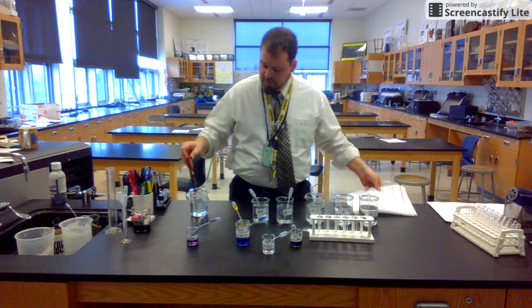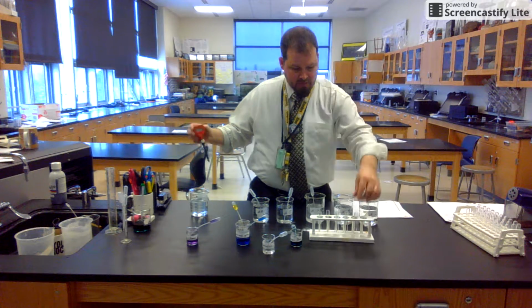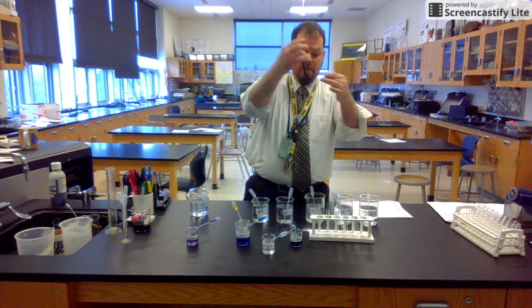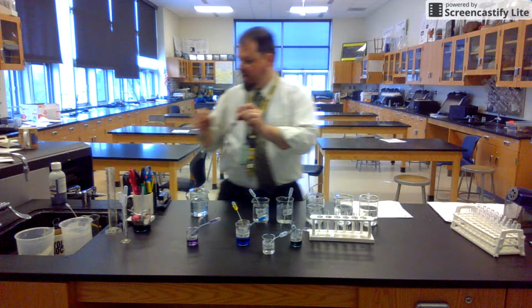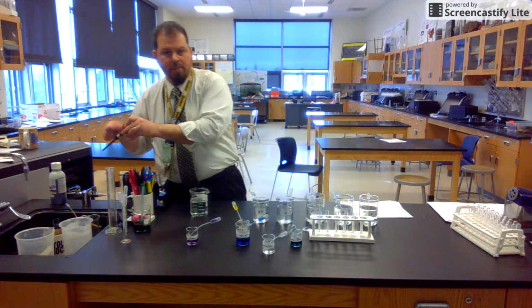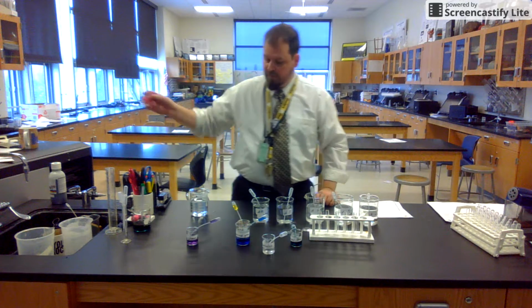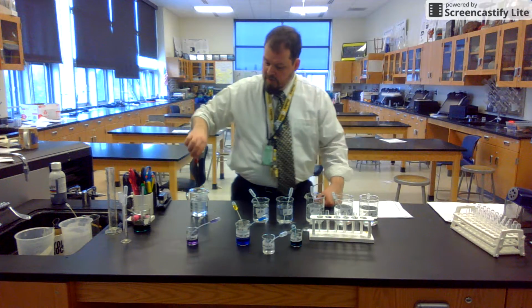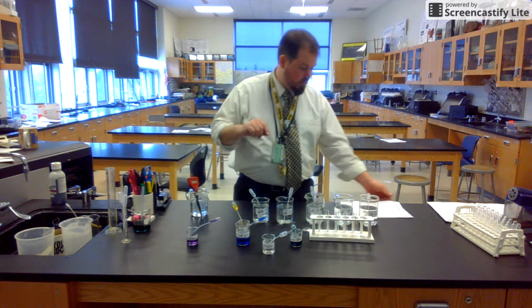You need to use the good old-fashioned pH meter. We're going to turn it on. It's going to give us a digital readout. I want you to actually, for pH 2, get me a pH reading. And here's the key. In between using this in each test tube, it needs to be rinsed thoroughly with running tap water or with the squirt bottle into the sink because otherwise it's going to affect the pH here. And it needs to be fully rinsed before it goes back in the water. It must be in the water at all times. We do not want to let this and its sensor be out and let it dry. That would be bad for the sensor and it's not going to read the right pH.